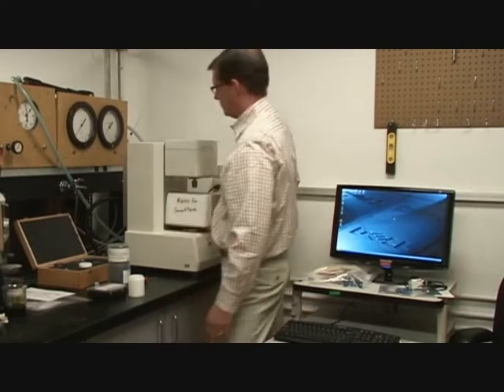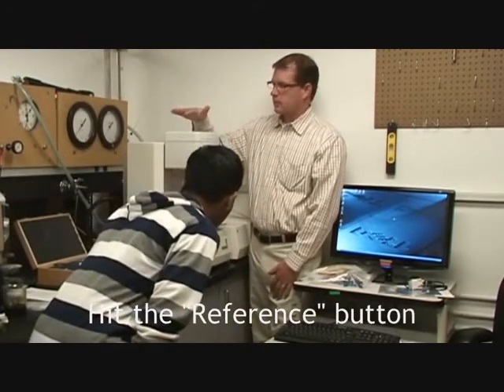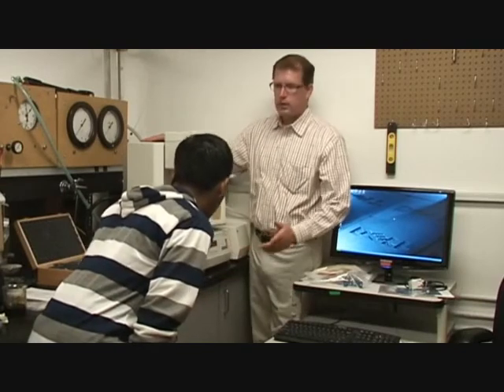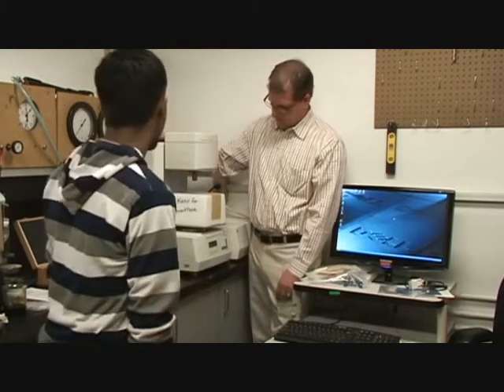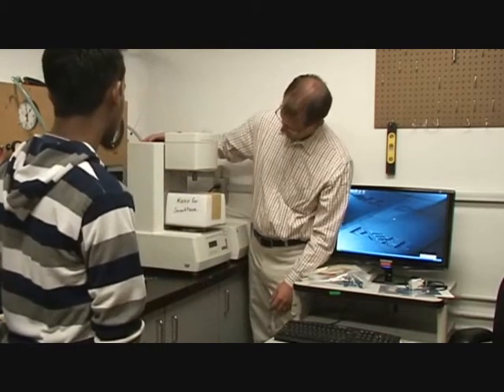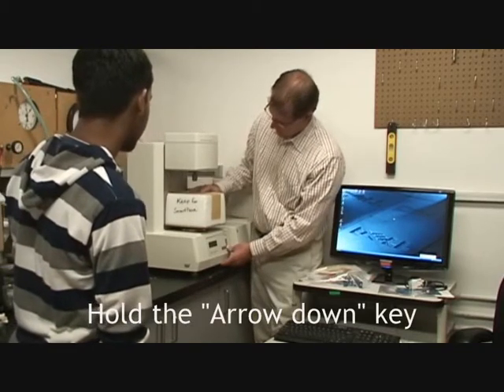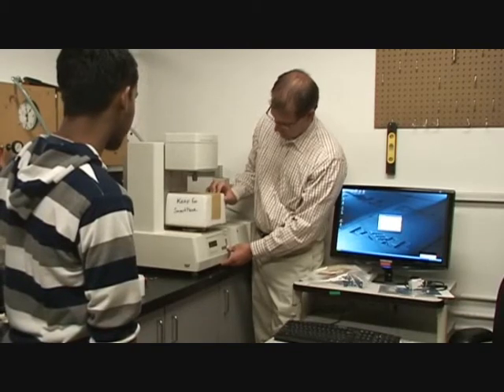Oh, there we go. So I hit the reference button. I'm sending it up to its reference position. Once it's at the reference position, it's going to know where it's at. That's the little REF button. Now I'm just going to hold the arrow down key down. And it's starting to move down.